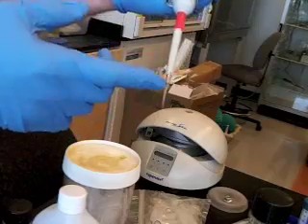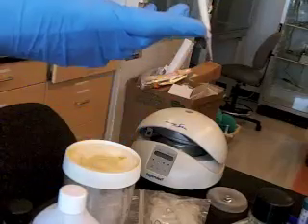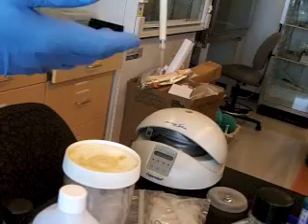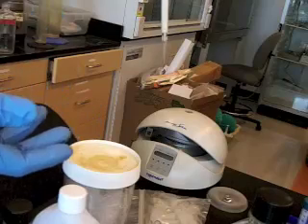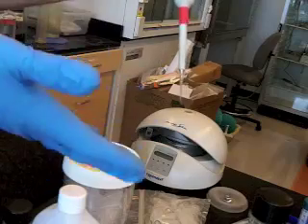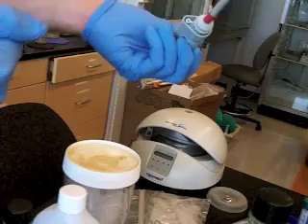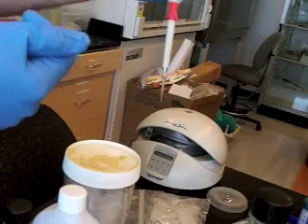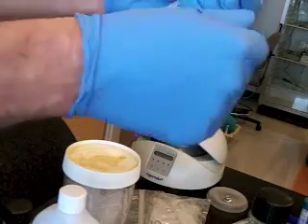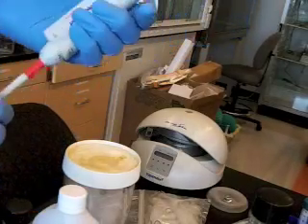You don't want liquid to splash and touch this shaft of the micropipetter inside of the tip. And you want to be really careful with that. And we'll talk some about that. If it happens, it's considered contaminated and bad. And that can happen either by splashing things up, by lifting stuff up too quickly, or by tipping it. So when you have a volume in a micropipetter, you don't want to tip it like that. Sometimes you think, oh, I got to get the cap back on this tube, but you don't want to tip a micropipetter up like that when it has liquid in it.